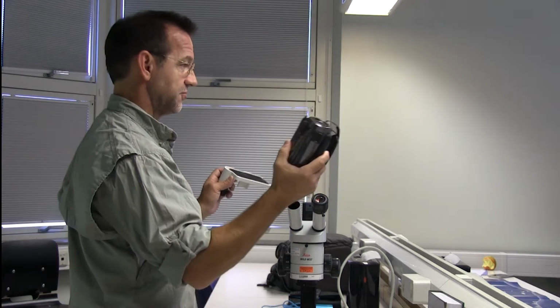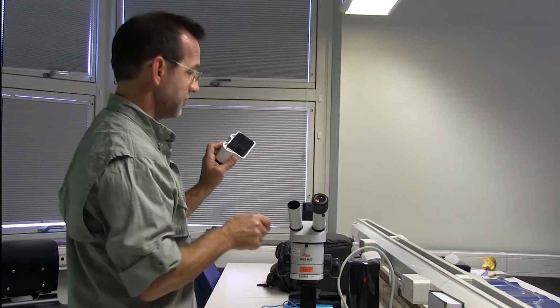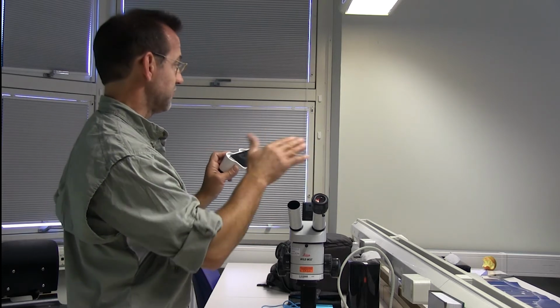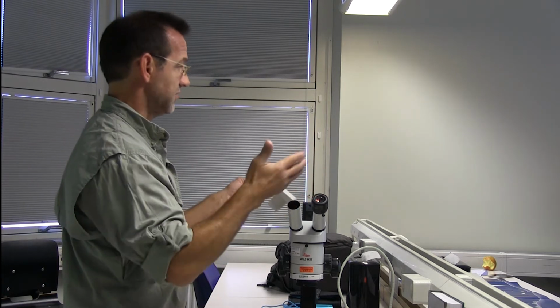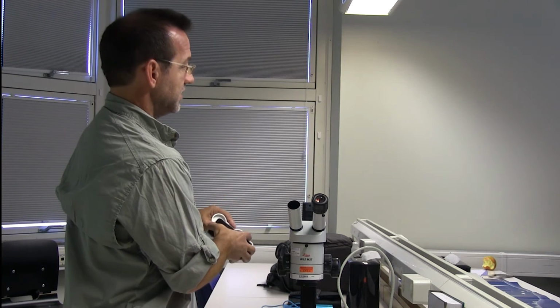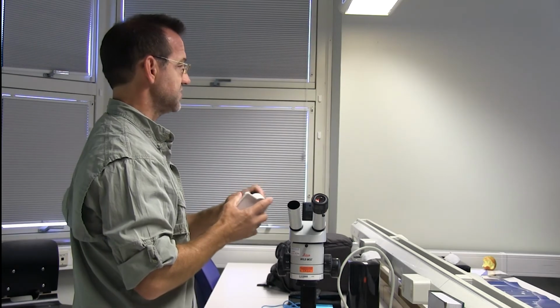So using this or this, you need to be able to set in manual focus, and then you just use the microscope to do your focusing. So autofocus you have to turn off somehow. So the iPhone camera it's always in autofocus. But apps that you get can be put into manual focus. So that's a big advantage. Probably find one pretty easily.